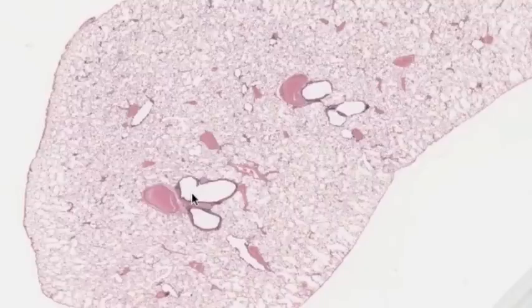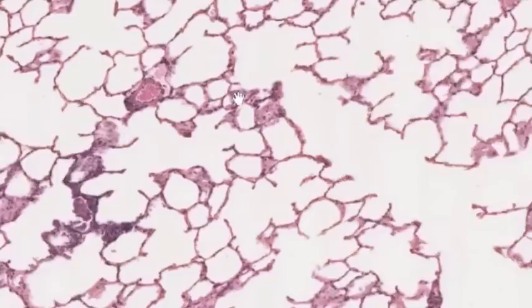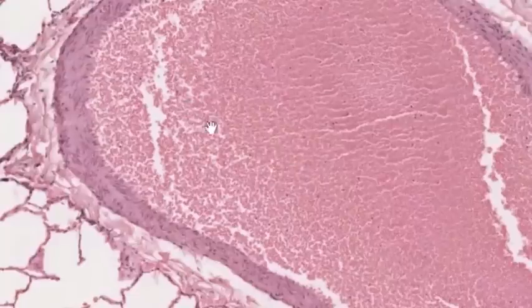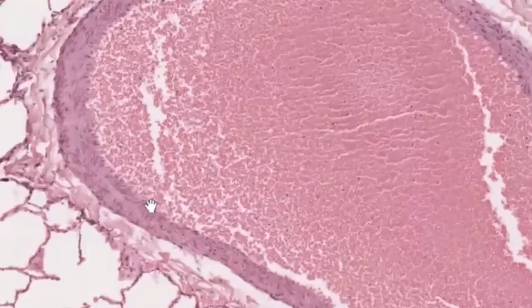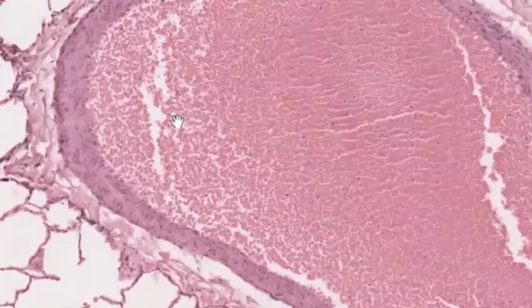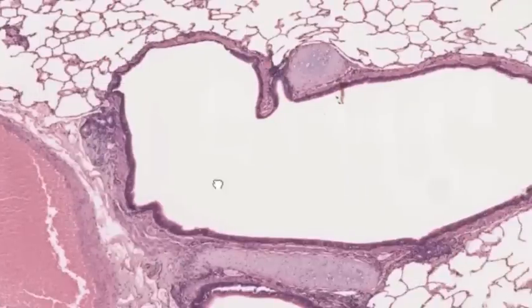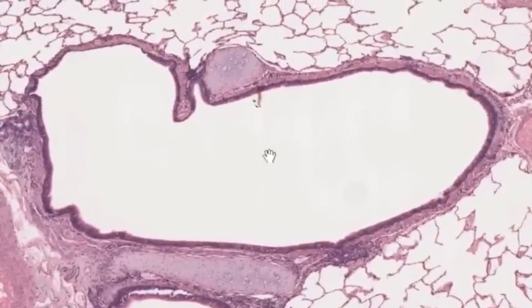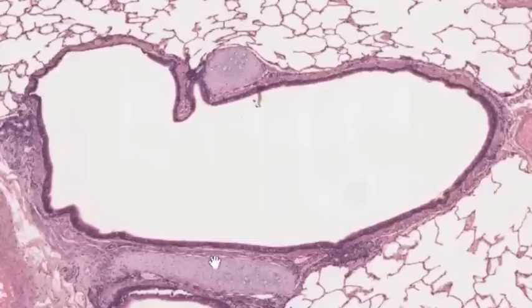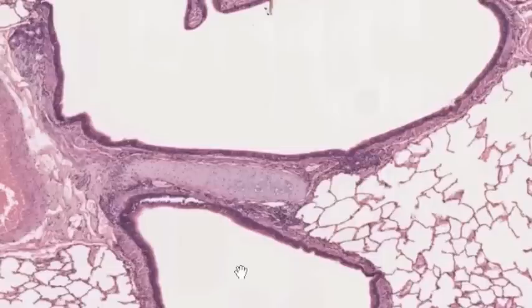Let's increase magnification and look at the wall structure of one of these larger air tubes. Here we have a very large vessel with red blood cells in the center — this is a branch of the pulmonary artery. It accompanies a structure through which air passes, and it should be immediately apparent that there's a lump of hyaline cartilage right here and a larger lump here. In fact what we're looking at is a branch point where a bronchus is dividing into two smaller bronchi.